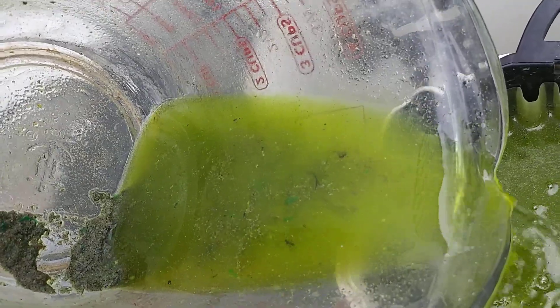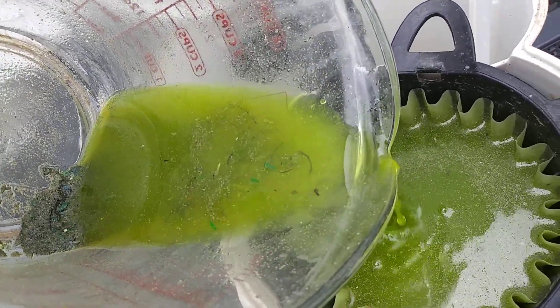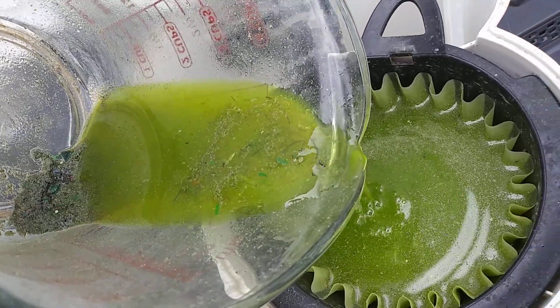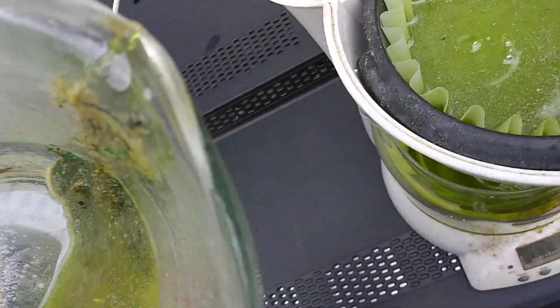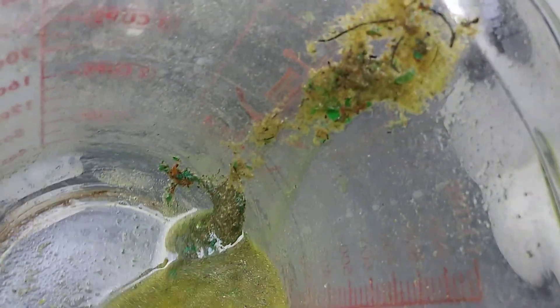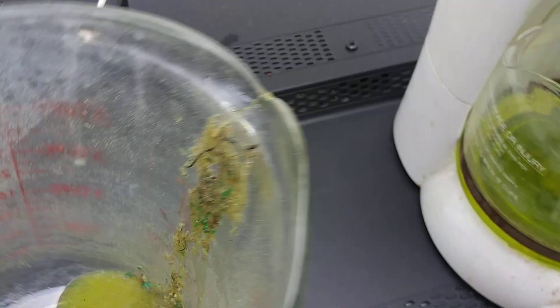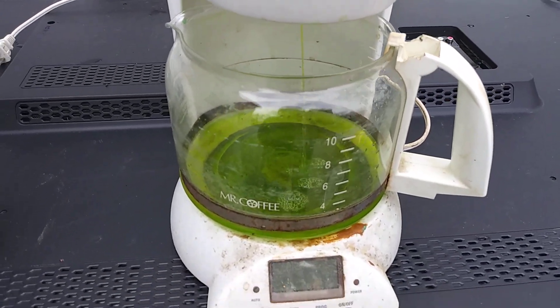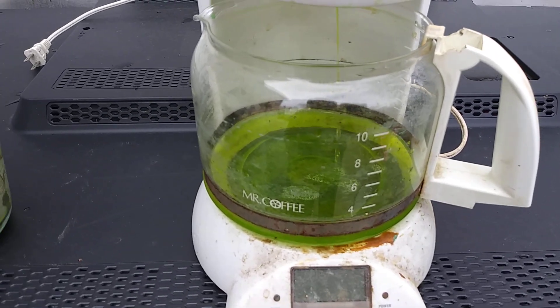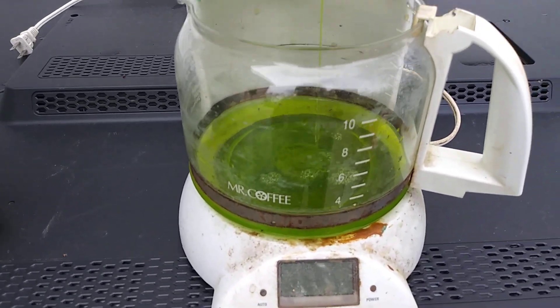That's got all the gunk in there. That's what clogs up the filter, though. So there's fiber in there, there's a big ol' booger. But this is the filtering process. I'm going to end part two here — I just wanted to show you how I did that.